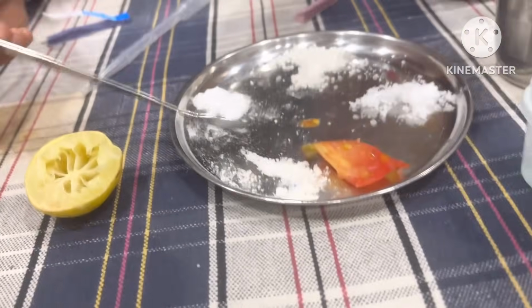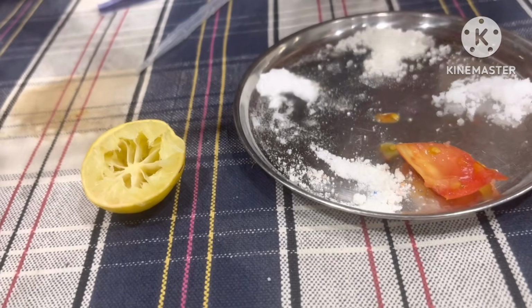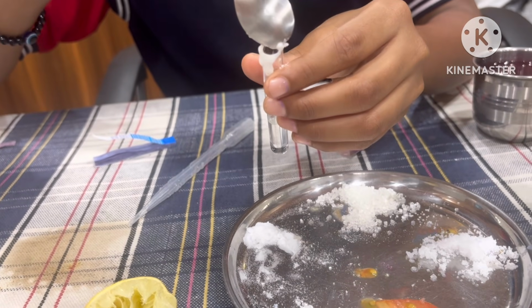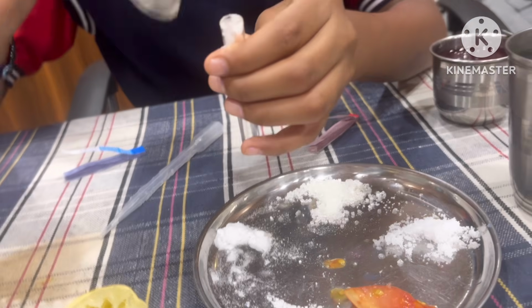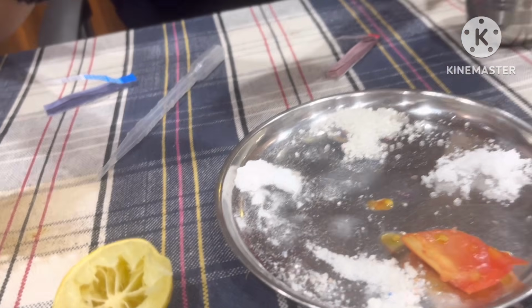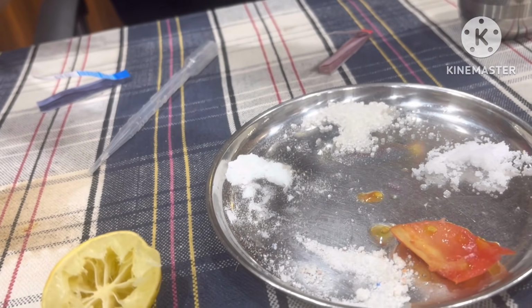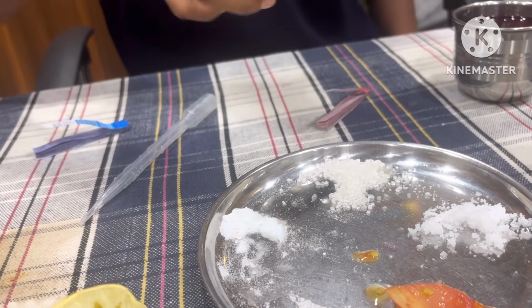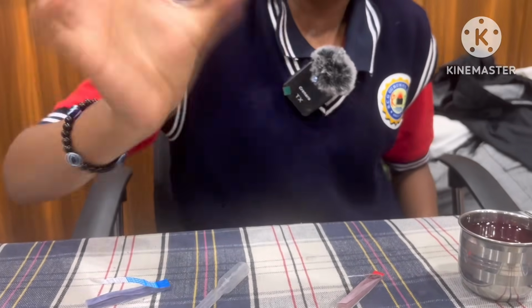and baking soda. It is not put in water. Why is it put in water again and again? You only use the dry spatula and mix it well.